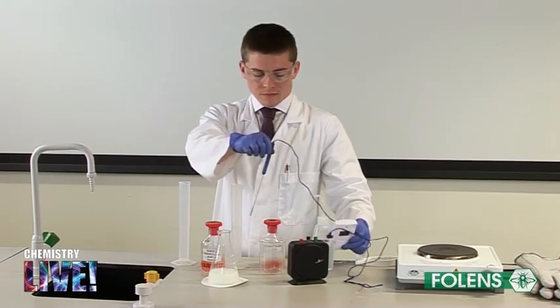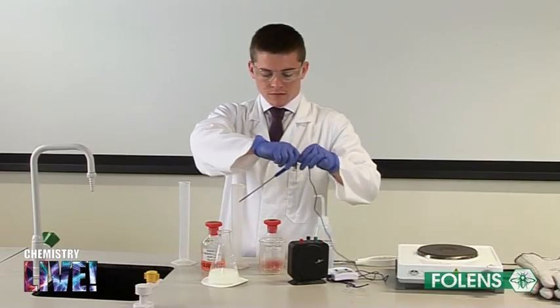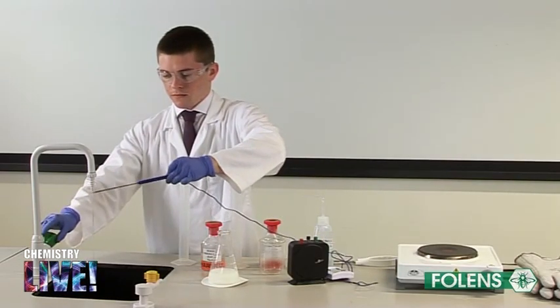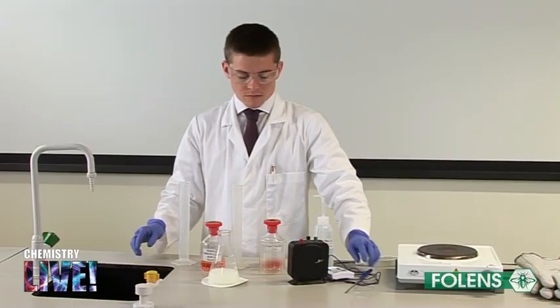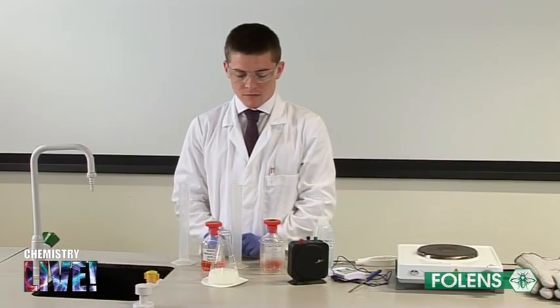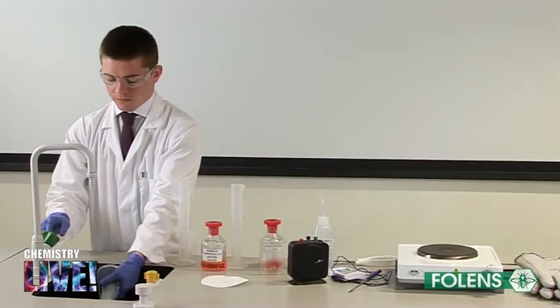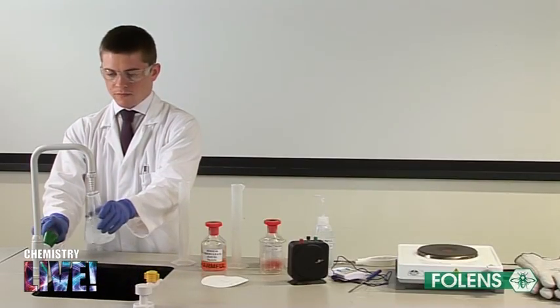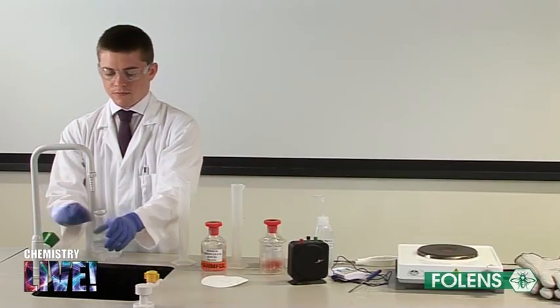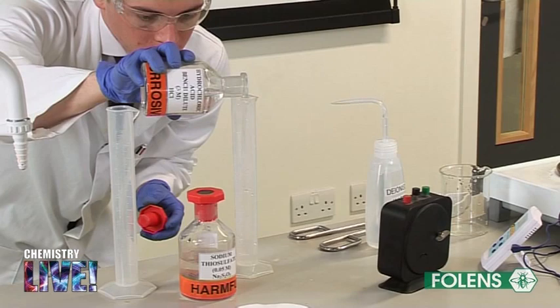You should find that the hotter solution takes less time to obscure the cross. That is, increased temperature causes an increased reaction rate. The result of this experiment can also be represented on graphs and these graphs are shown in your textbook. This concludes the experiment.